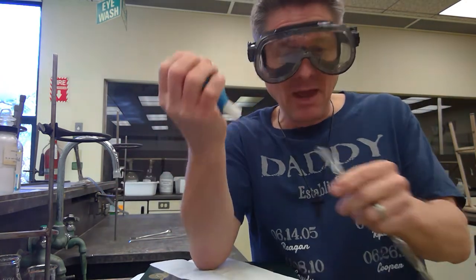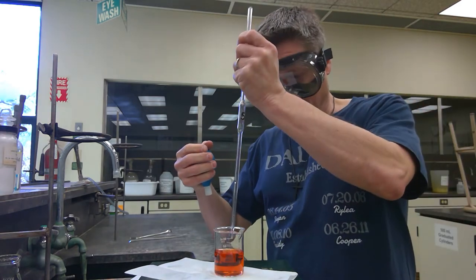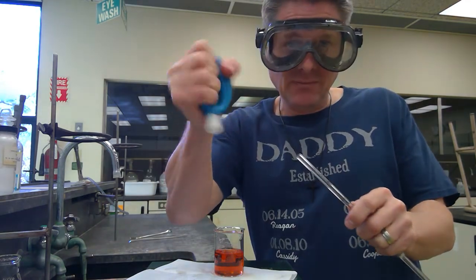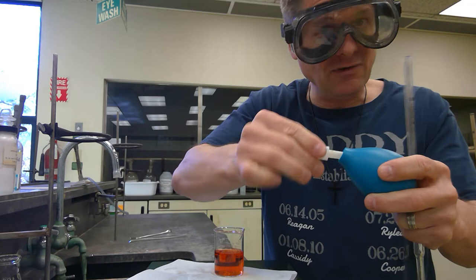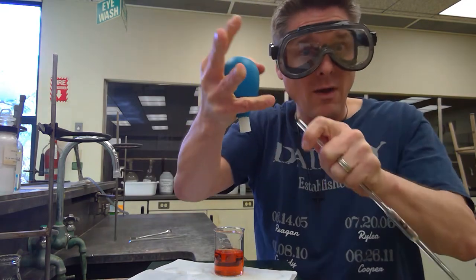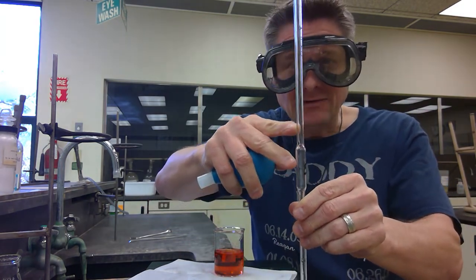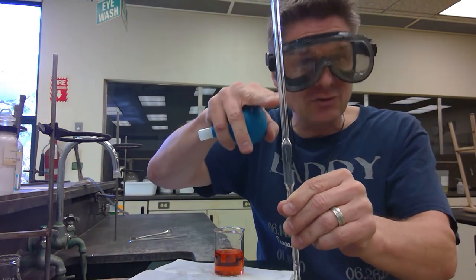The key aspect is we're going to squeeze this ahead of time. Don't set it on there and then squeeze it — especially if you've got it inside a solution, because it's like blowing into a straw and it bubbles over. My recommendation is to squeeze it as hard as you can, set it on nice and snug before you put it in. Check to make sure the little white part isn't out so it's nice and snug with no liquid in the bulb. We're going to squeeze on it, set it in the liquid, and then don't just let go — that'll release pressure and suck it up really fast. You want to bring the solution up really slow until you're about two to four centimeters above that demarcation line.